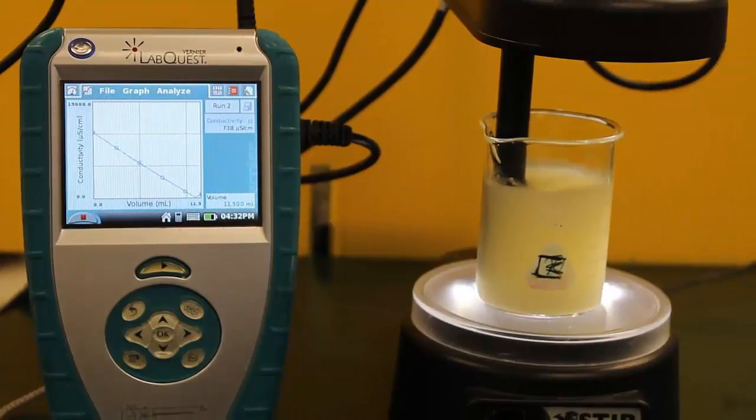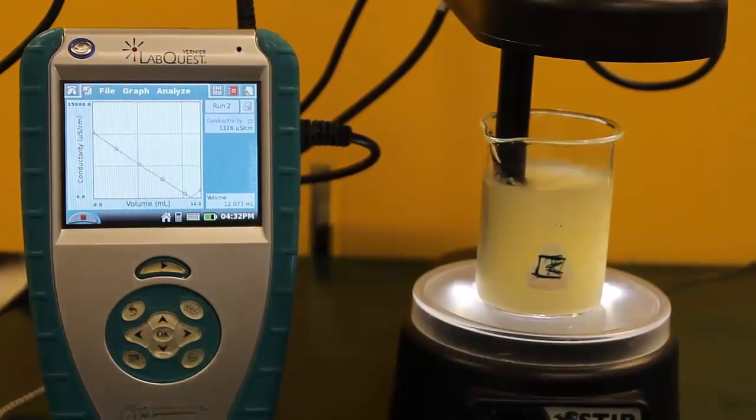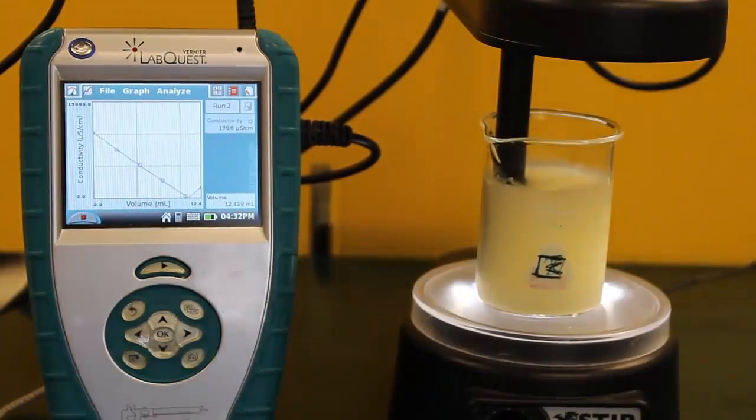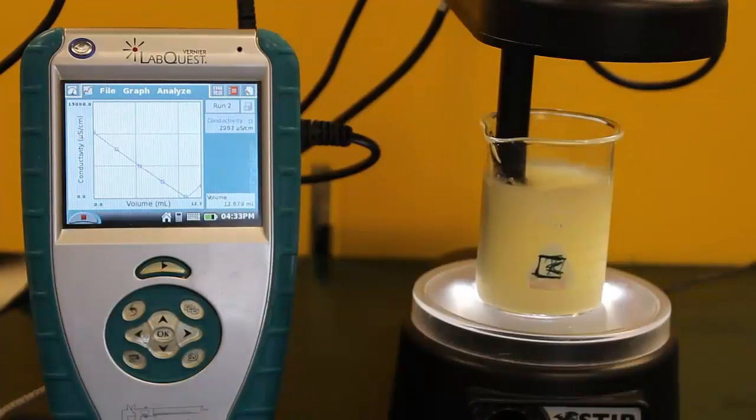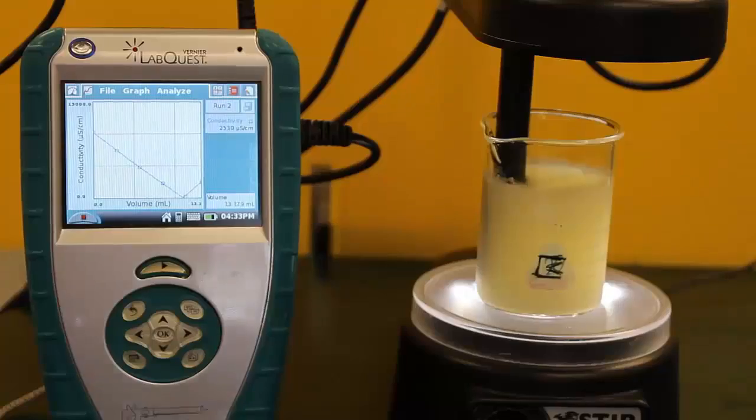Speeding up the video again, the conductivity of the solution continues to increase linearly with increased concentration of the hydrogen and sulfate ions.